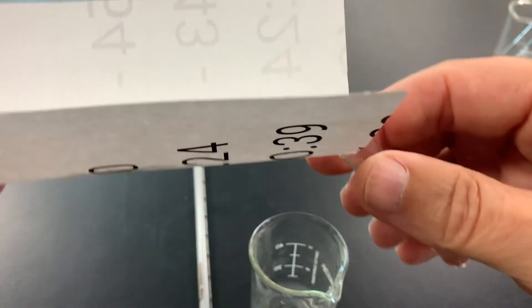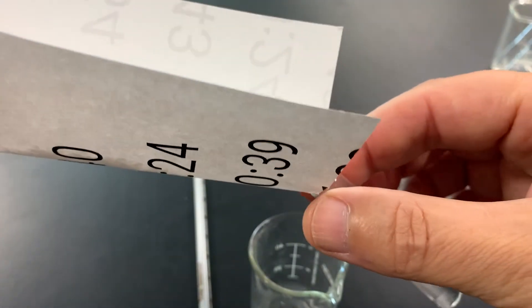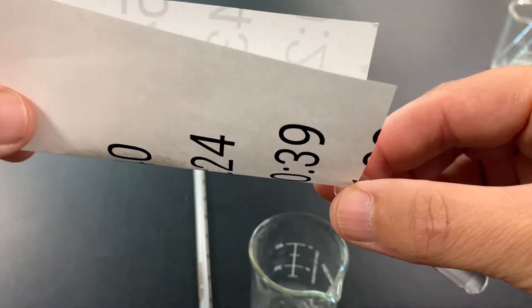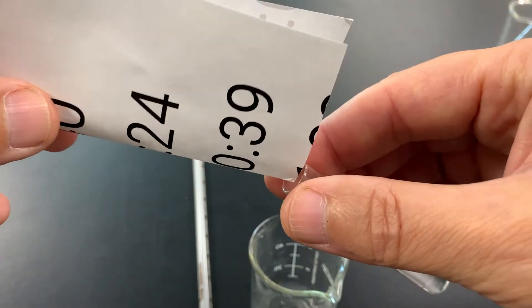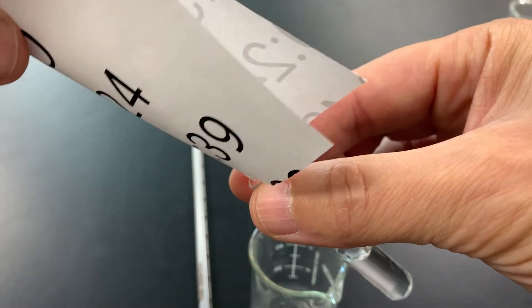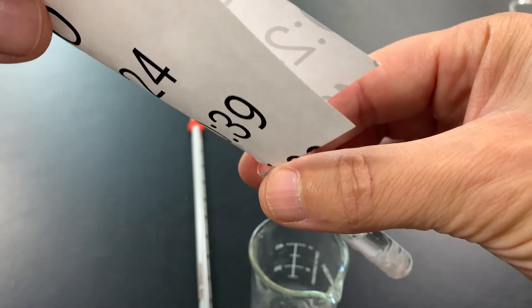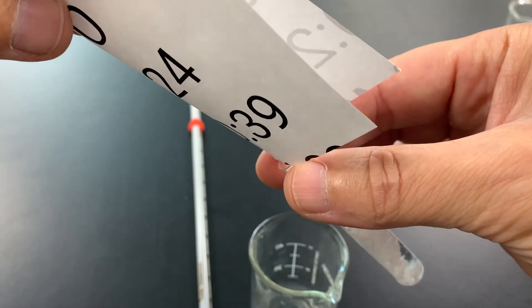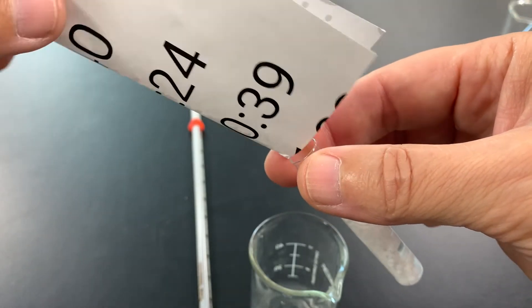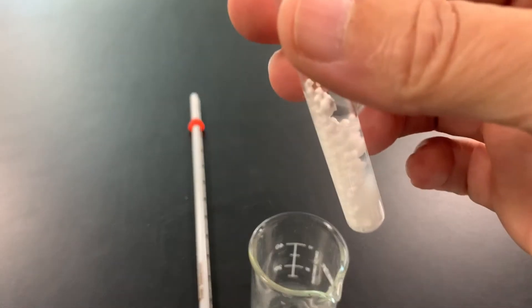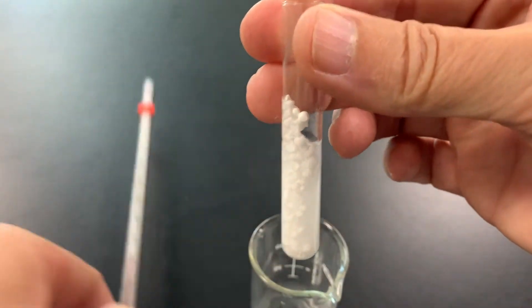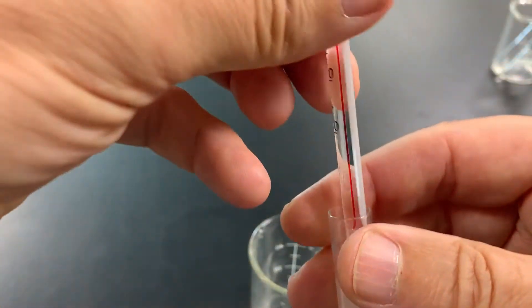I'm going to take that, and I'm going to dump it into this little test tube right here. I'm going to try and pour as much as I can in, and you'll see it going in there. I may not need all of it. That's probably good enough. Now you can see it in there, and I'm going to mix it up, and I'm going to watch the thermometer.